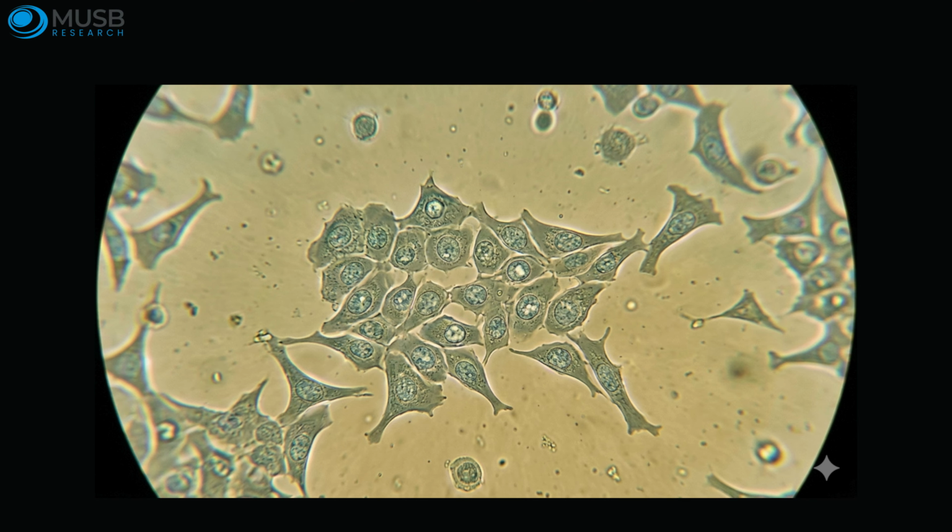Experienced cell biologists can look at a flask for 30 seconds and tell you the confluency, the health status, whether contamination is present, and whether the cells are ready for passaging. That expertise is not magic, it is a trained visual vocabulary. This episode gives you that vocabulary.